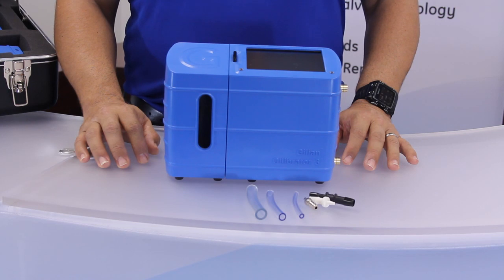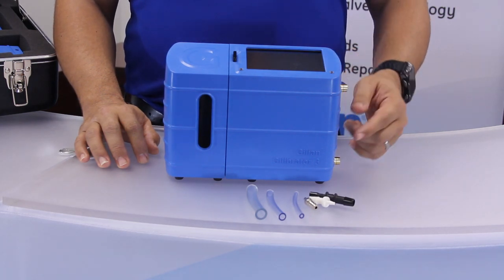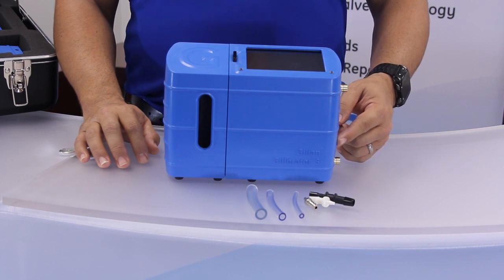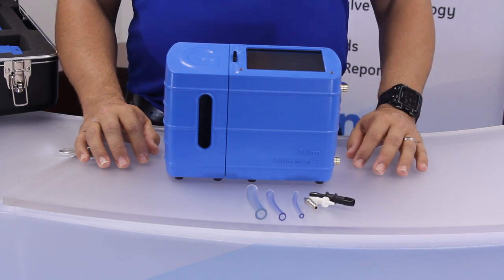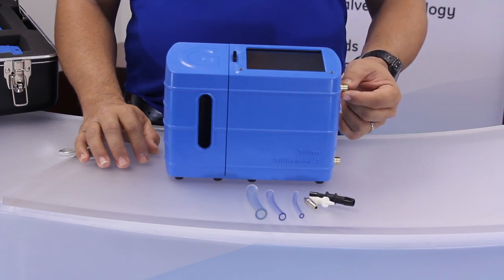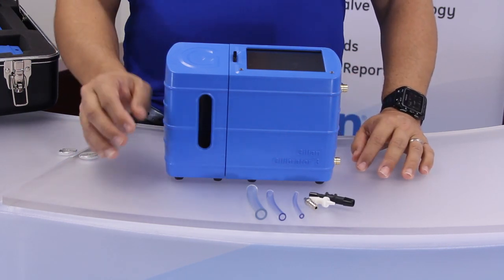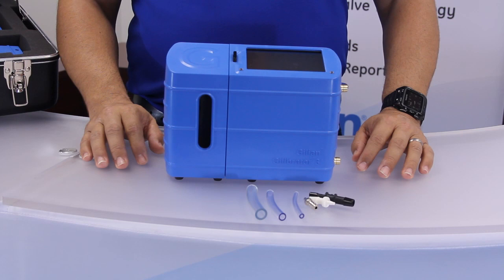The sampling source to be calibrated may be either a positive pressure device like exhaust air, or a negative pressure device like a suction pump. Tubing must be selected based on the flow range and fittings. The calibration base unit comes with a standard 3/8 inch outside diameter fitting. Step-down adapters are provided with the kit: a 3/8 to 1/4 inch adapter and a 1/4 to 1/8 inch adapter.